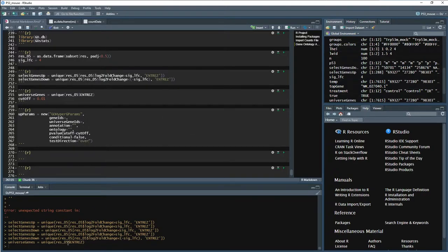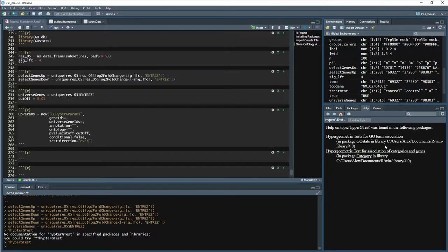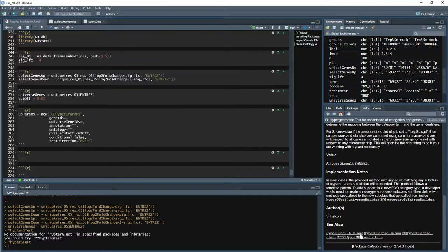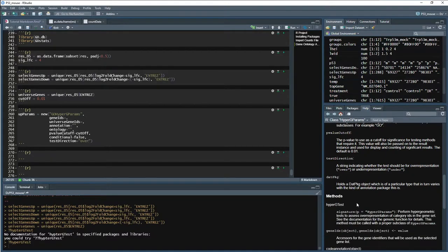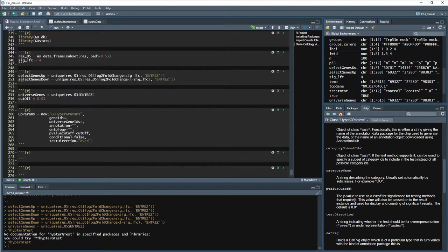And we can see what all of these mean. If you do, I think it's hyper G test, if we search. And then this guy. We want to look at the parameters for the class. So here we go. P-value cutoff that we had, test direction over or under, so we want to look at those that are overrepresented. Yeah. All right, let's go ahead and start filling this in.